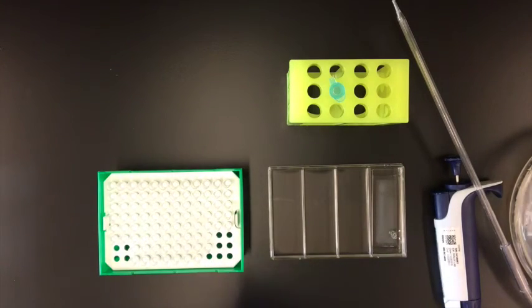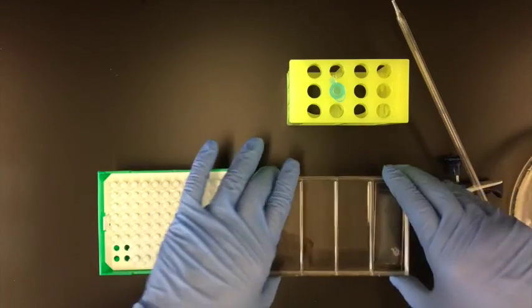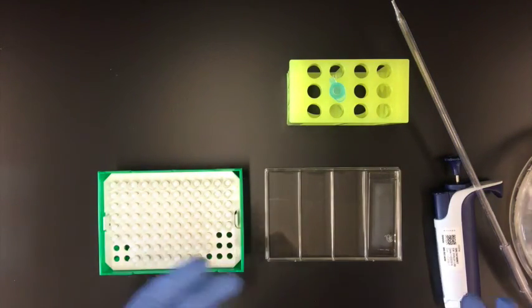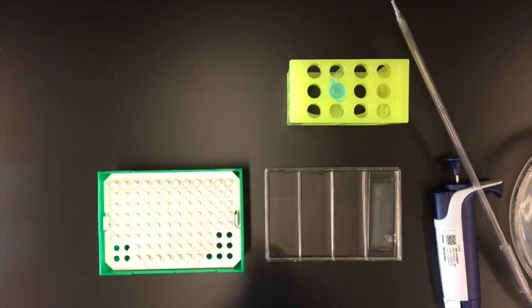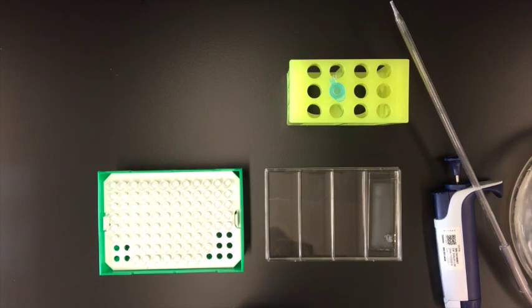The final thing that you can do is actually stick it back on the rotator like it is right now for about five minutes. This is something that I often like to do after I've done this and it helps to just fill in the gaps that manual loading might have missed. After this, you're ready to move on to washing. So you've looked at your array, you think it's sufficiently loaded, it's ready to go. So now you can just move to the washing procedure that's outlined in the protocol.